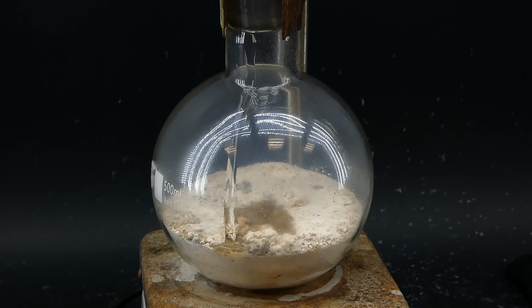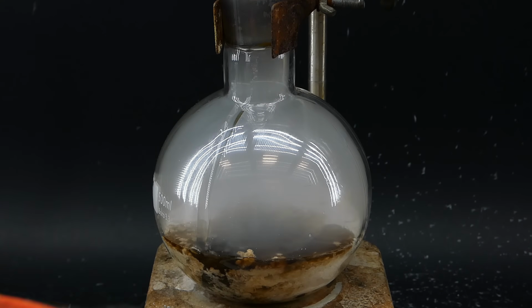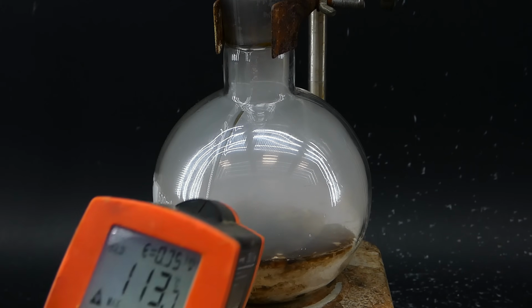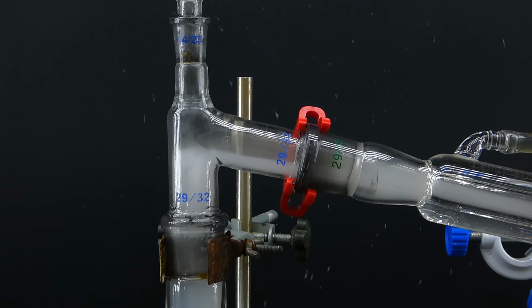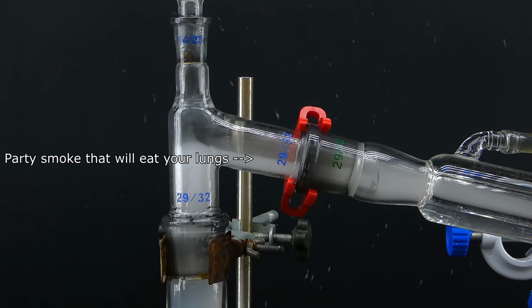Immediately upon contact, a lot of white smoke started to form, which was the vapor of pure acetic acid. The sulfuric acid addition generates so much heat that the acetic acid boils on its own and condenses on the walls of the boiling flask. Its vapors also start to escape and flood the apparatus, and honestly, they look really nice and kind of remind me of smoke made by party smoke machines.